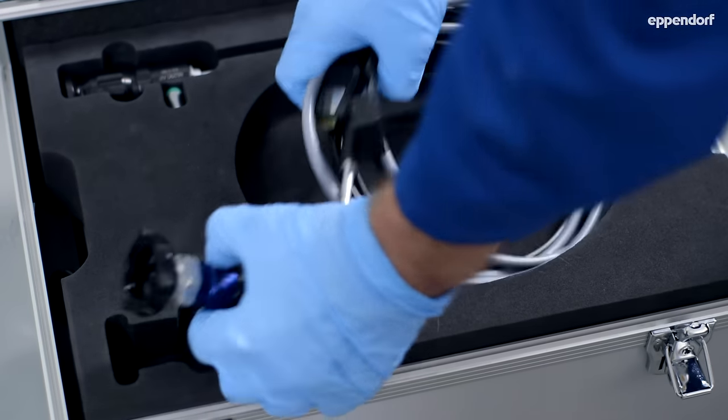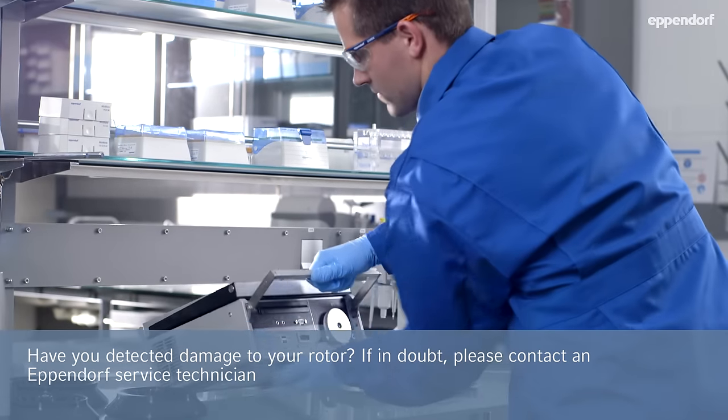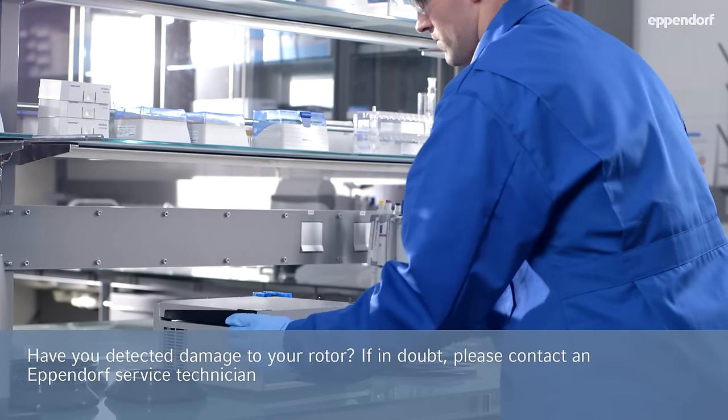If you are not sure about the safety of your equipment, please contact your regional Eppendorf service technician for professional inspection services.